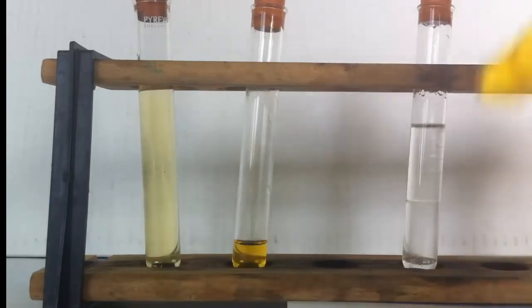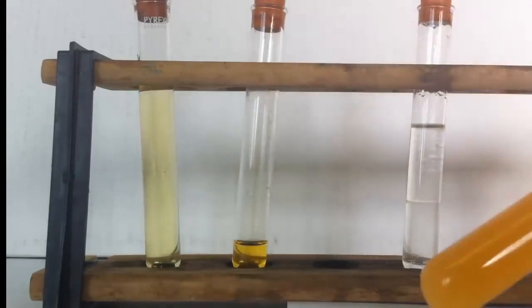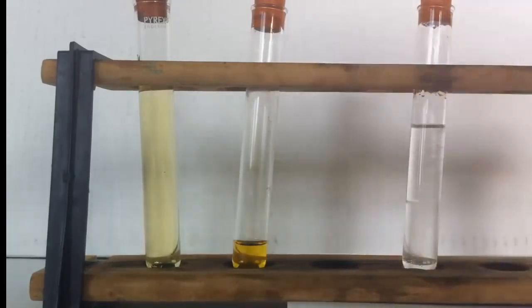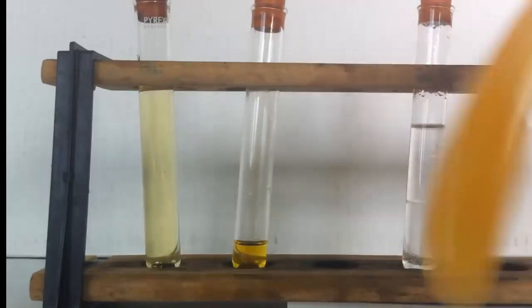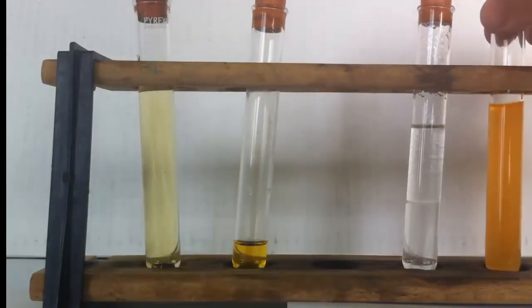So let's shake them. And the color you can see is persisting. And I'll allow that to settle for a few moments.